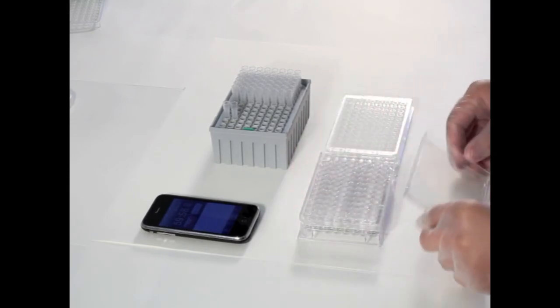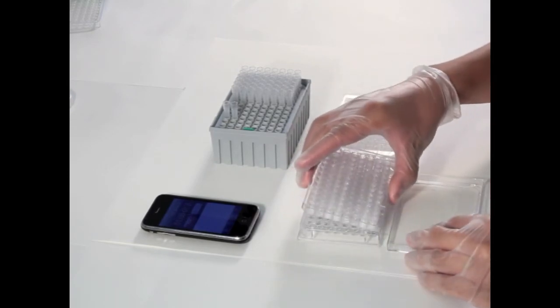After stirring, the top plate is detached and aliquots of the acceptor phase are taken for analysis.